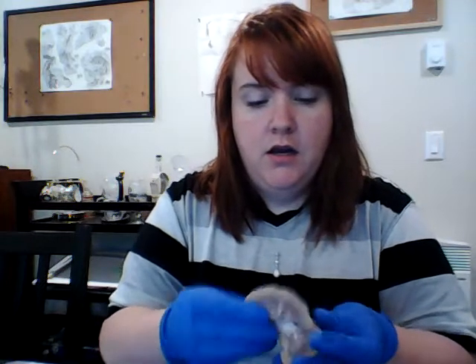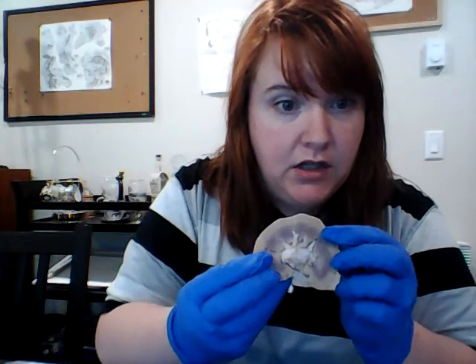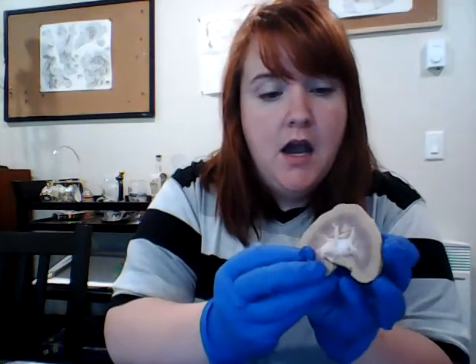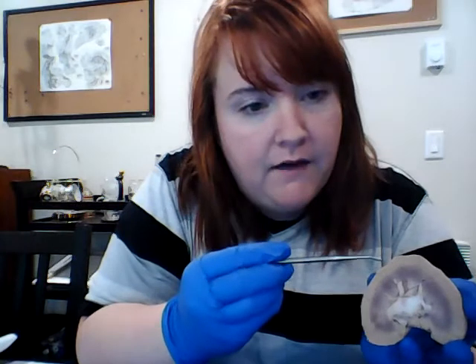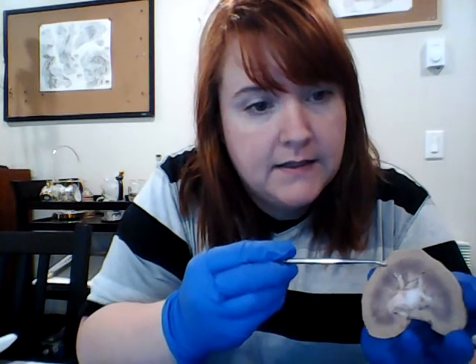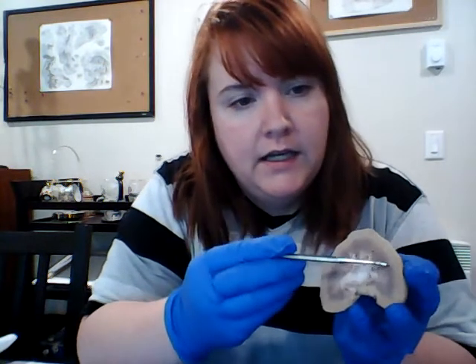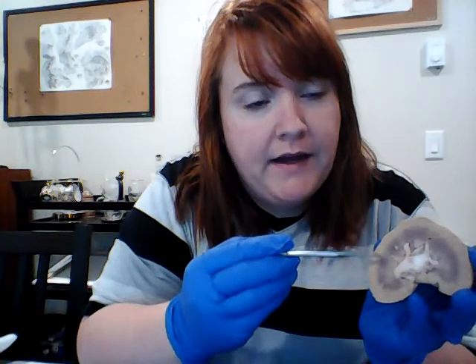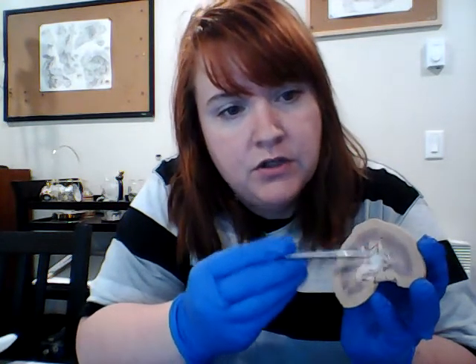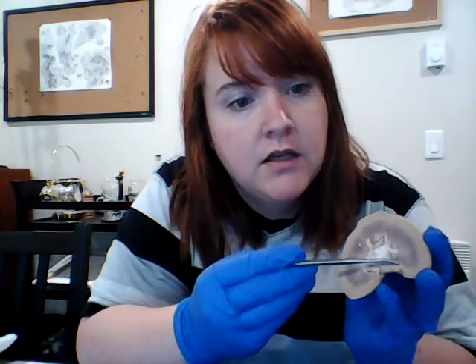So for this, we have pretty easy to see actually on the screen. I was surprised. So right here we have the renal cortex. This is the outside of the kidney. Inside here, all of this section right here is called the renal medulla, and it's separated by several structures. Each little pyramid thing here that you see, those are the renal pyramids of the renal medulla.